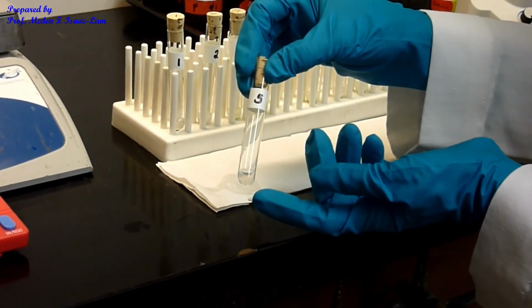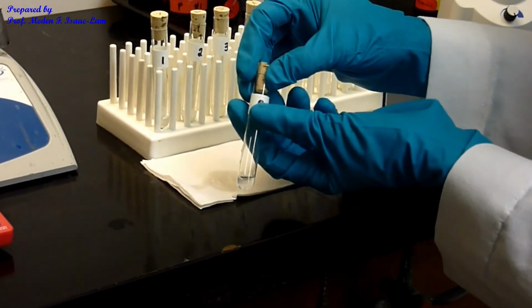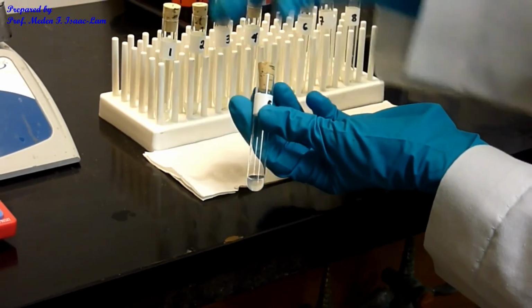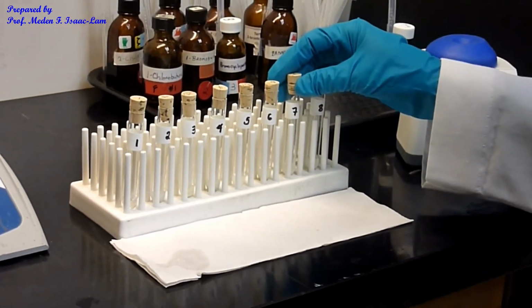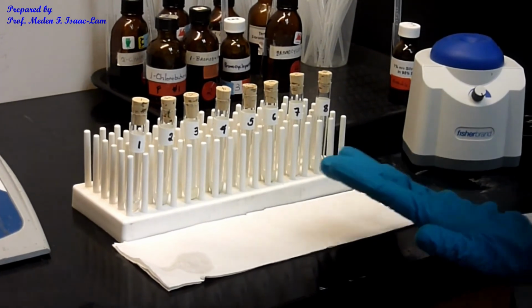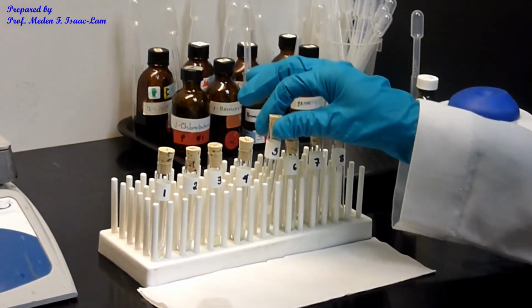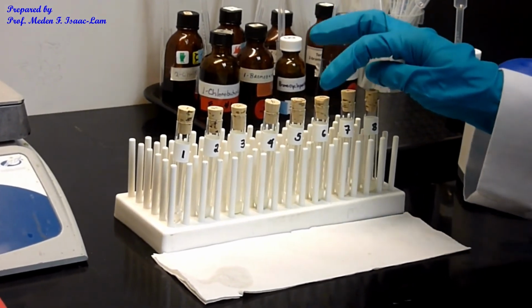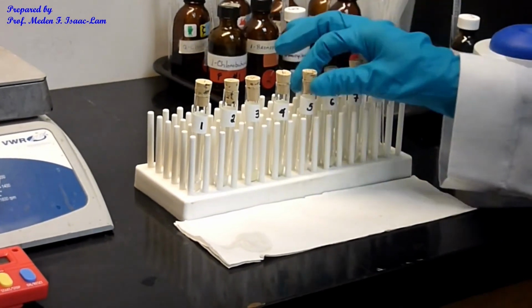I see, so a lot less intense, and then the least is 1. So 1 is unreactive, followed by 5. All right. So now let's do again. The fastest is 8, followed by 7, and then 6, 3, and 4 are almost the same in terms of the intensity of the precipitate, followed by 2, followed by 5, and the least is 1. So again, 8, 7, 6, 4, and 3 are almost the same, followed by 2, 5, and 1.